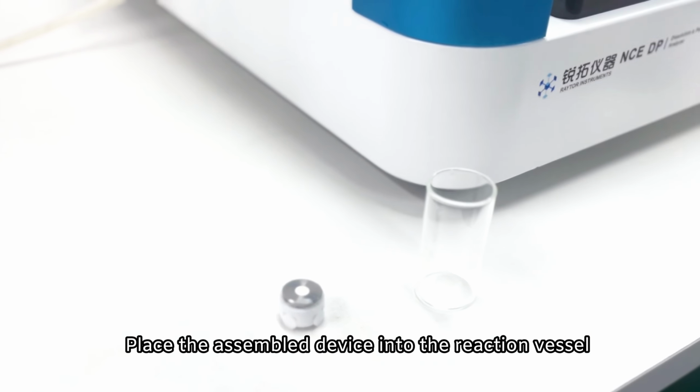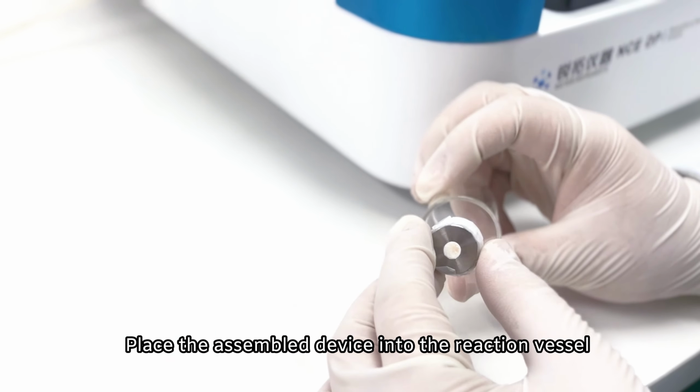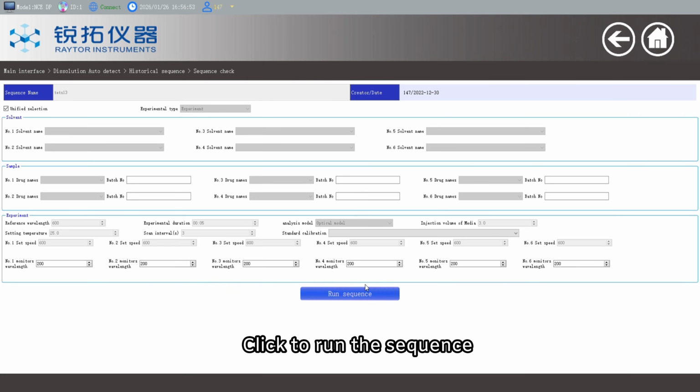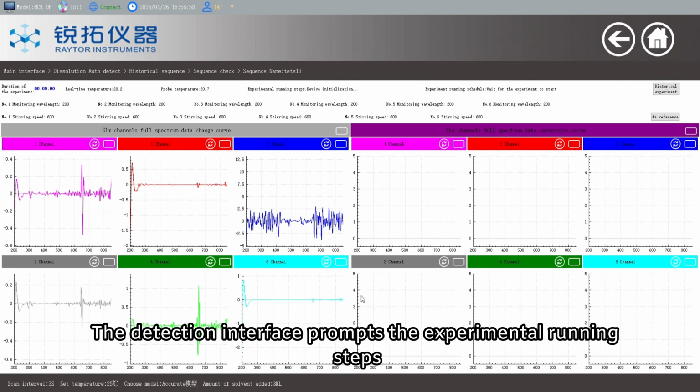Place the assembled device into the reaction vessel. Then it was placed in the reaction tank. Click to run the sequence. The detection interface prompts the experimental running steps.